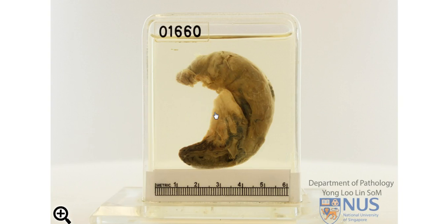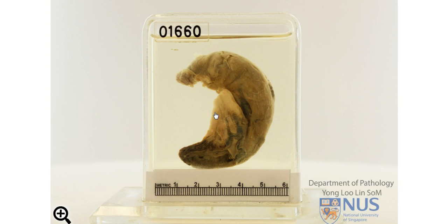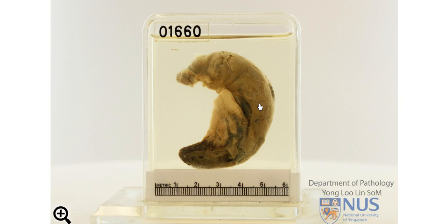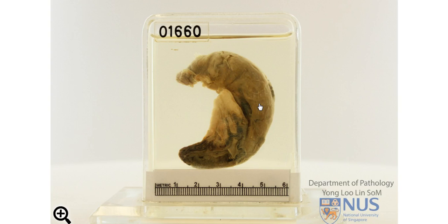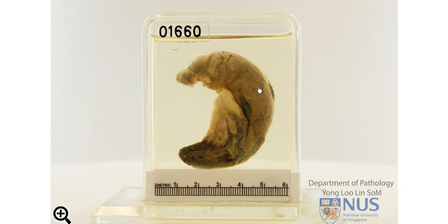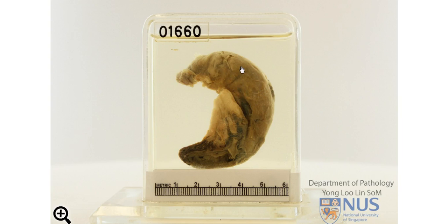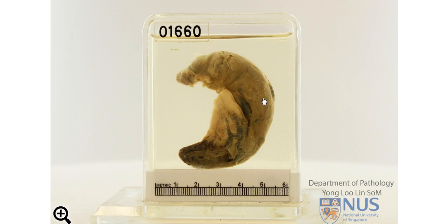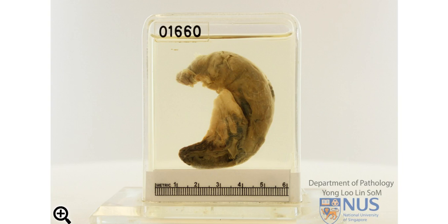So this is a gross specimen showing the features of acute appendicitis. Clinically, the patient would present with right iliac fossa pain, guarding of the abdomen, and tenderness. When the surgeon has a look at the appendix, it will be swollen or turgid, and he or she would be able to actually see these exudates on the serosa, which is indicative of acute appendicitis.